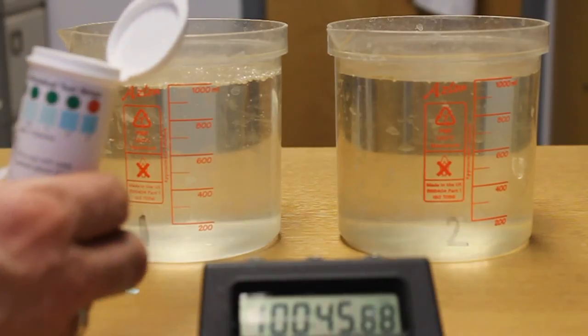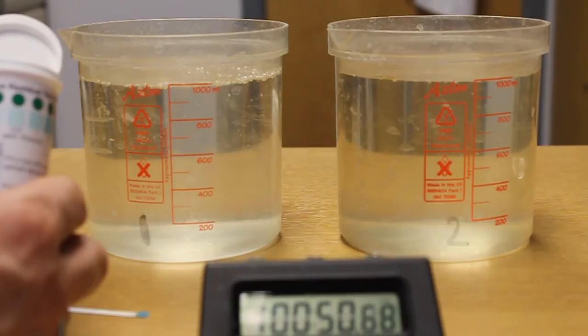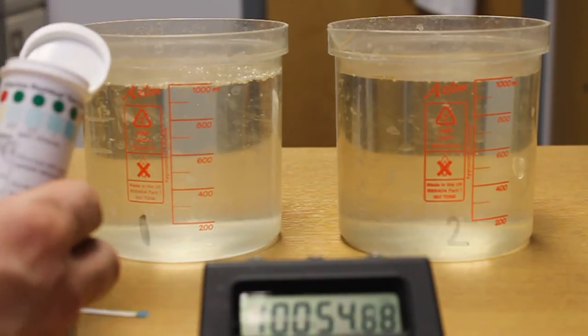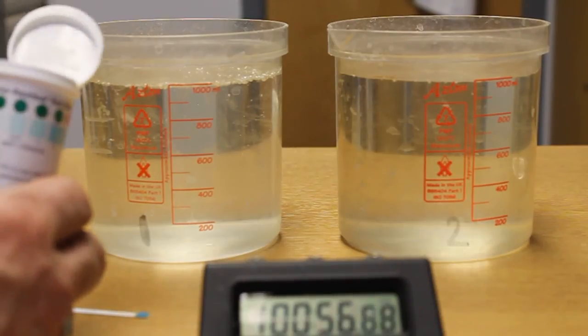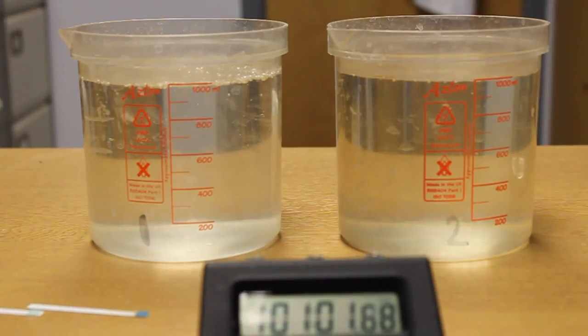Now because the first strip had 0.3 within it, there was enough chlorine. If you had tested the test strip and not seen any chlorine, then you would know you would have to use a higher dose. So for instance, if we look at the water which hasn't been treated.